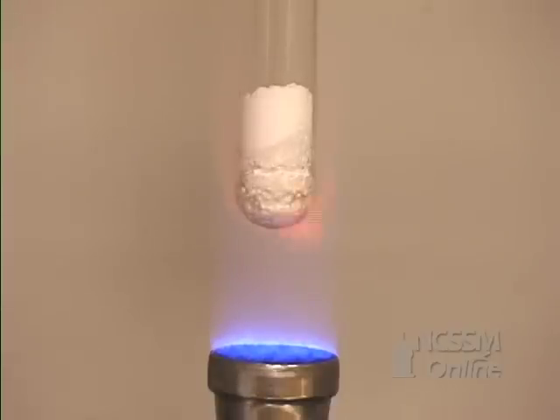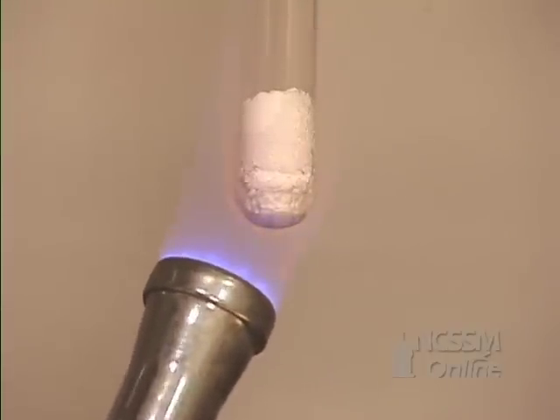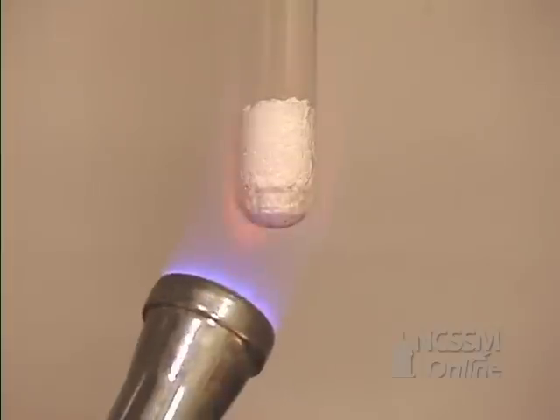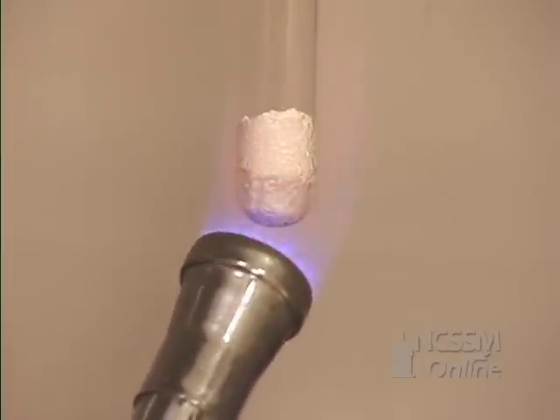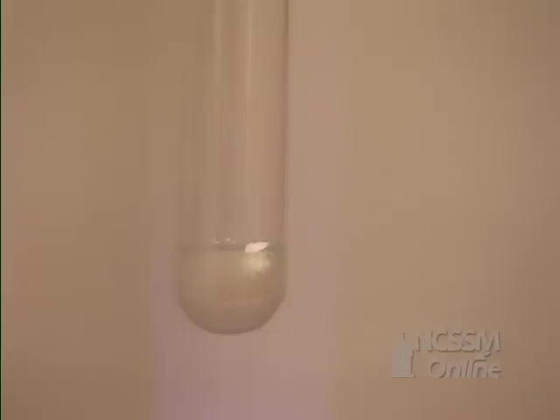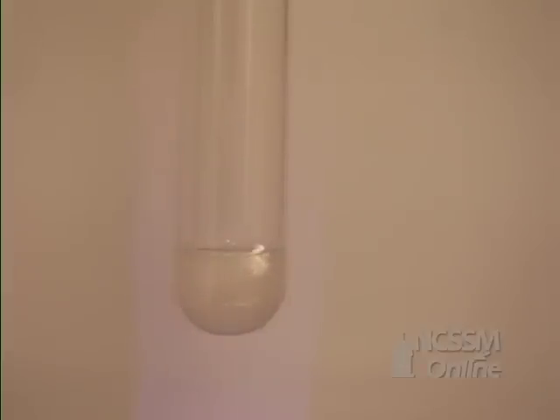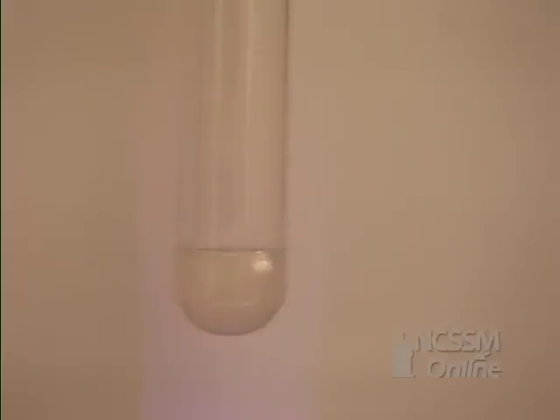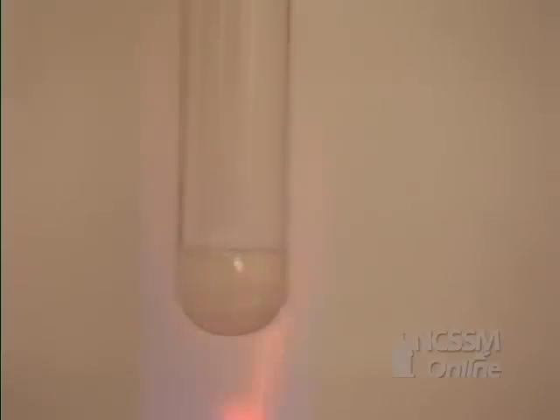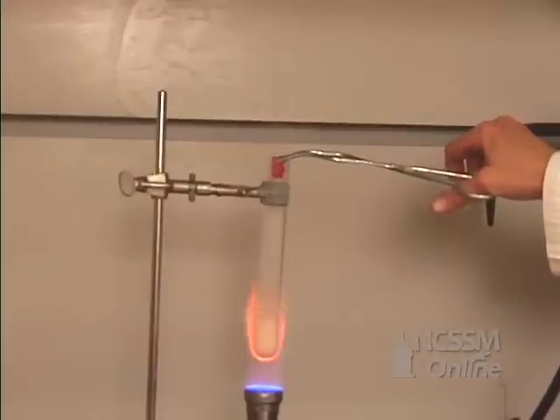You can see that the potassium chlorate is beginning to melt. After it melts, it will begin to decompose. You can see gas bubbles coming off, so we're going to drop our gummy bear into the solution.